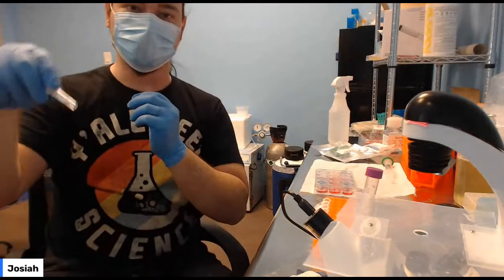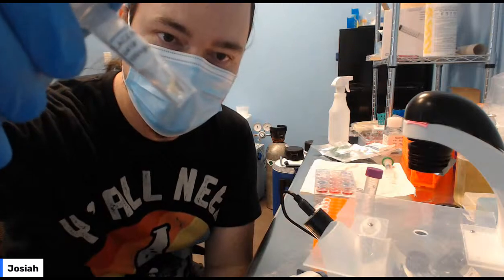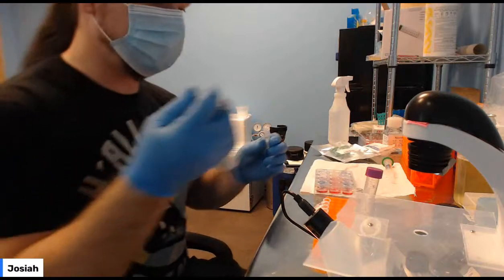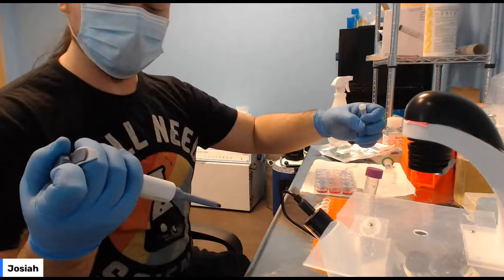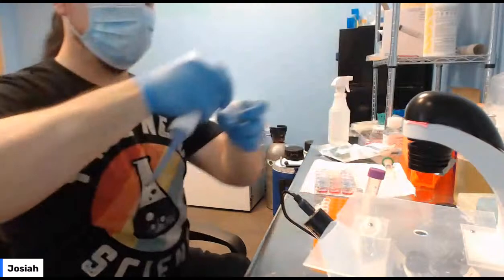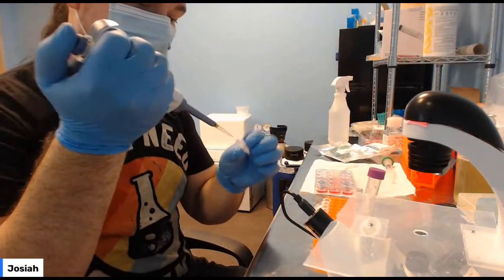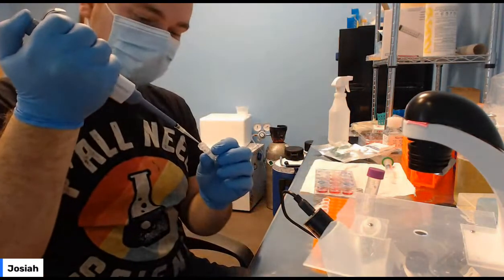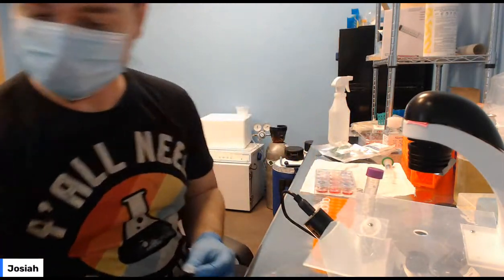Then shake it down towards the end in a whip-like motion and get everything down at the bottom. So there's our plasmid. With that new pipette tip, I'm going to go down to 10 microliters. Collect that. We'll put 10 microliters in 2 of these reactions. So 1. You really should get a new tip, but I'm going to rush because of our audio issues. 2. Okay.